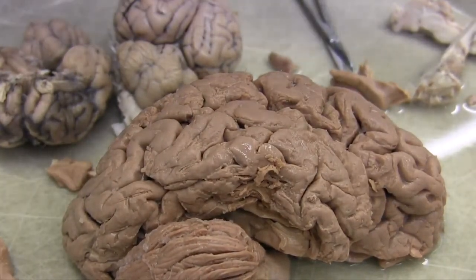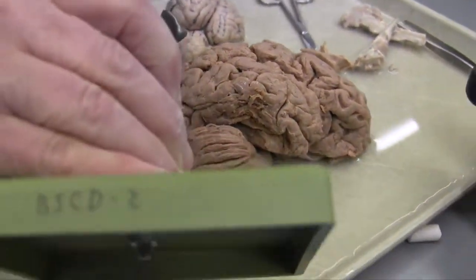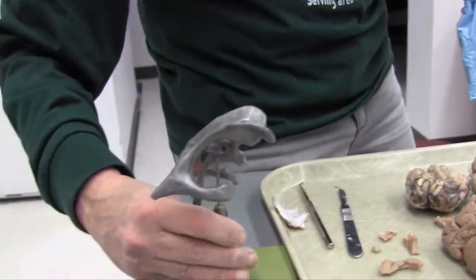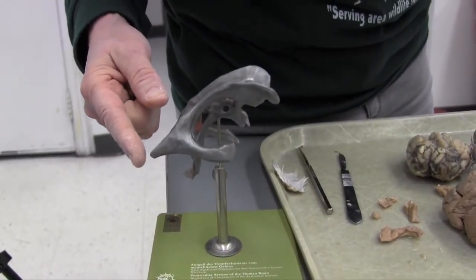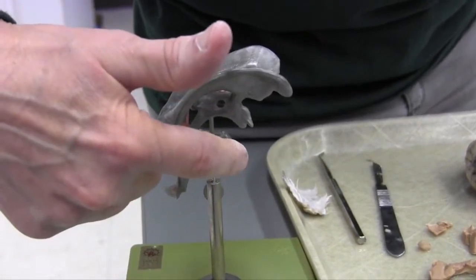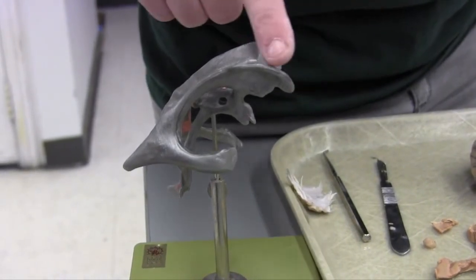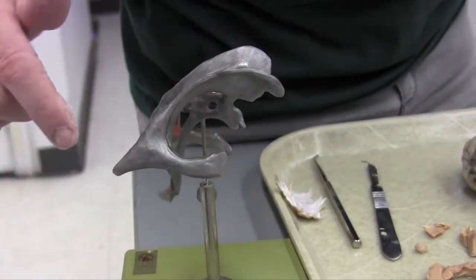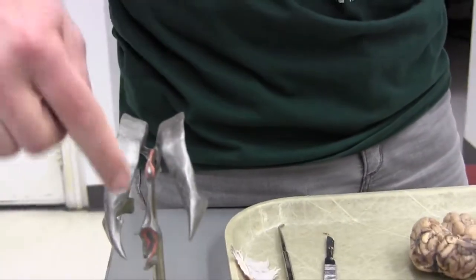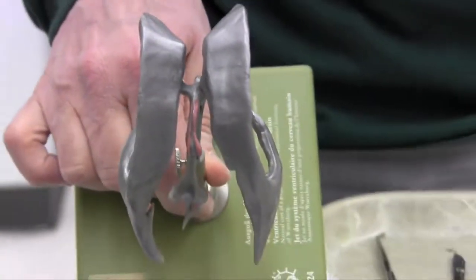So let's do one thing. Let's just take a look at this. So you can see this is back at the end of the occipital pole. Right down under here is the hippocampus. This is the temporal pole of the lateral ventricle, and that was the frontal pole of the lateral ventricle. A nice C. And if you look down on it, you can see that it's not in plane. It comes out as it goes forward. Do you see that? It comes out as it goes forward.